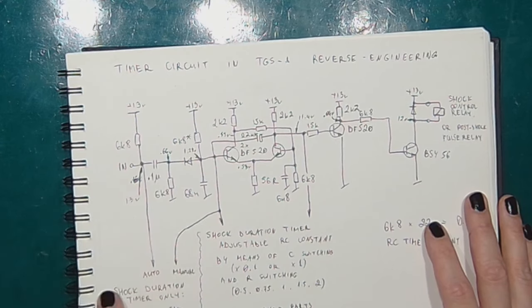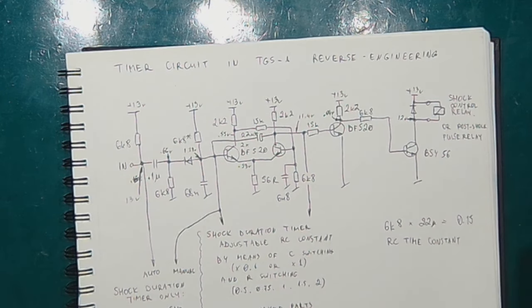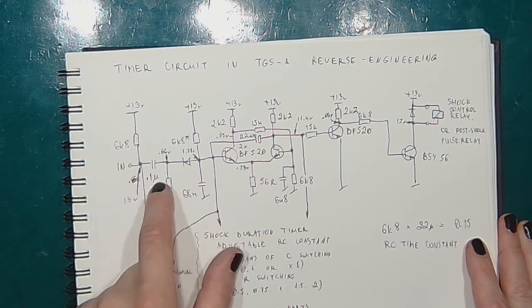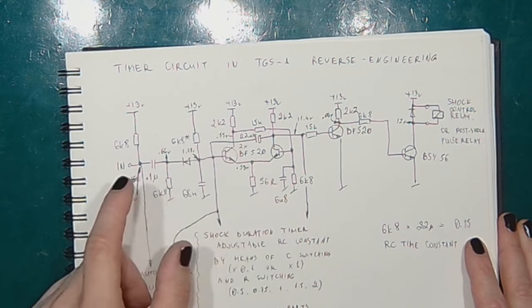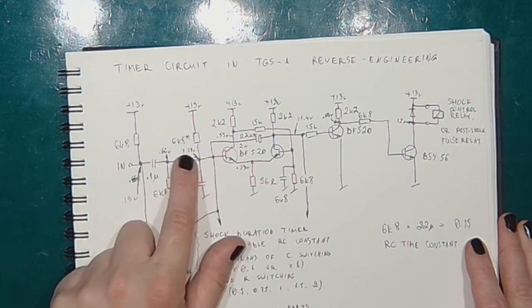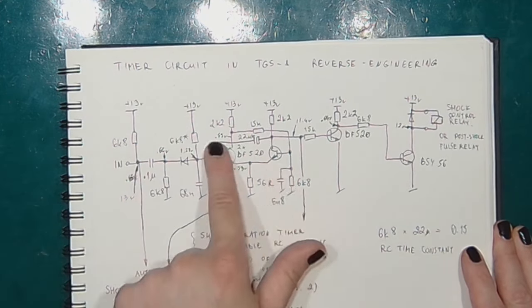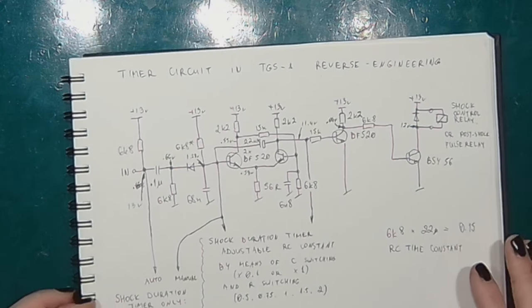And after releasing the switch, we don't want to have a high voltage spike on the base of the transistor, and this diode prevents that. And this would be a one-shot trigger.